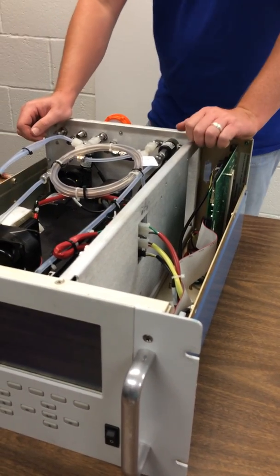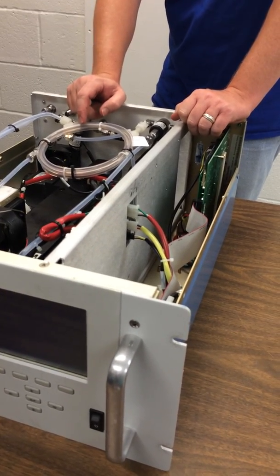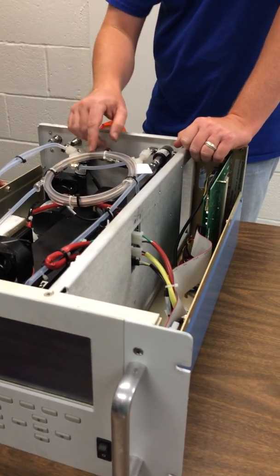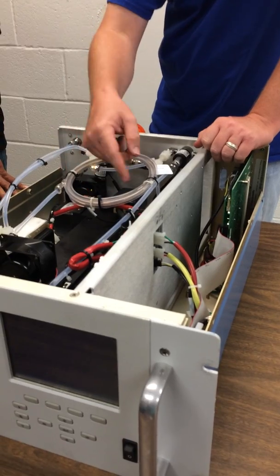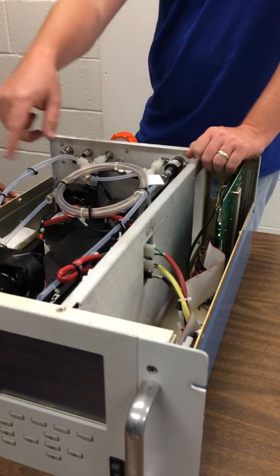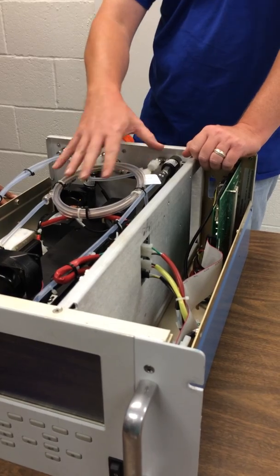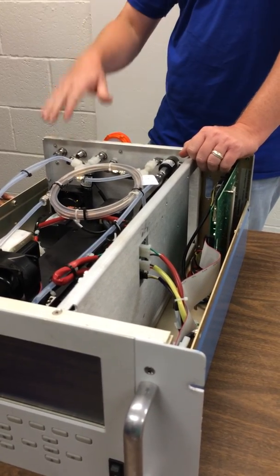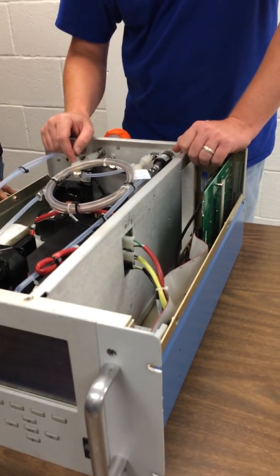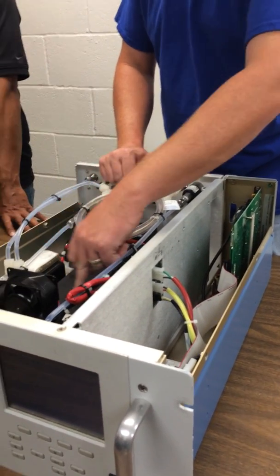This one, the sample comes in, and this is a permeation dryer because water absorbs IR. So what we do is it comes through the center tube. The outer tube is at lower pressure, and it's already been through the instrument, so it's already been dried. So then it pulls the moisture from the ambient sample out to the outer sheath and then gets ejected out in the exhaust. So it comes through, it gets dried, it goes around and around. Then it comes in through into this bench. It comes in from underneath.